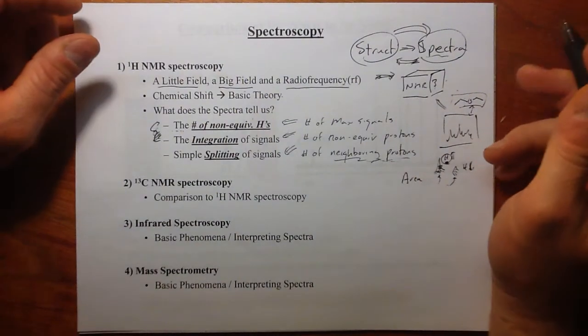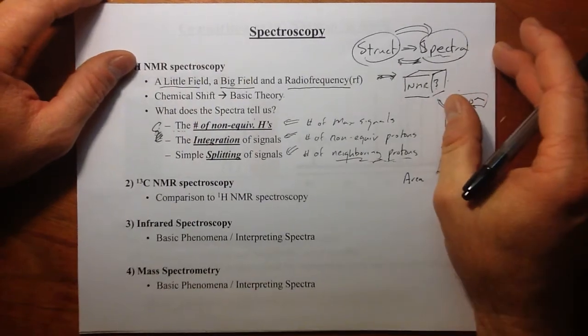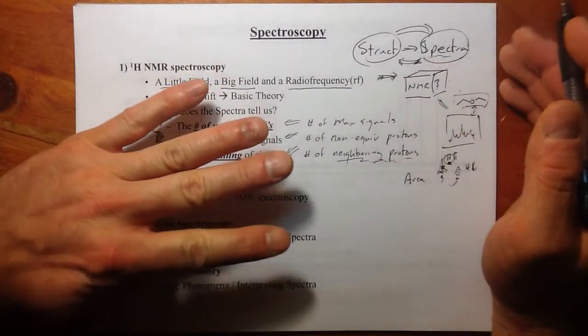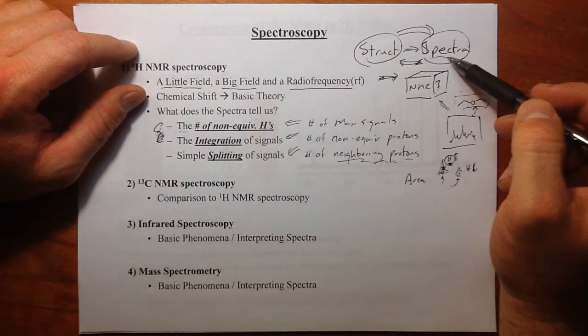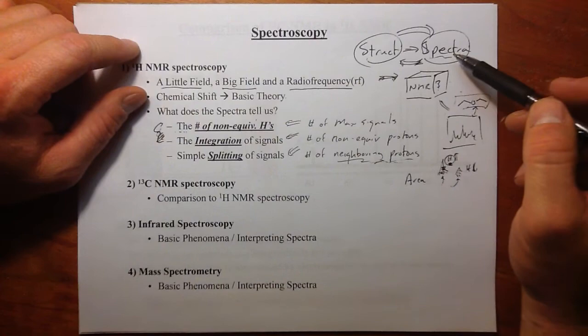Well, we're rolling right along. This is the fifth of 6 videos on characterization of organic compounds. And we have looked for the last 4 videos at either taking in a structure and elucidating or determining what the theoretical spectrum might look like for that structure by proton NMR spectroscopy.